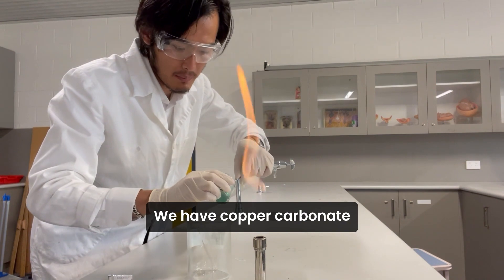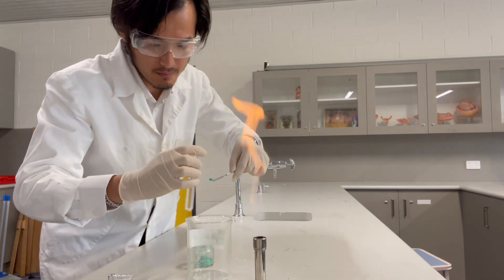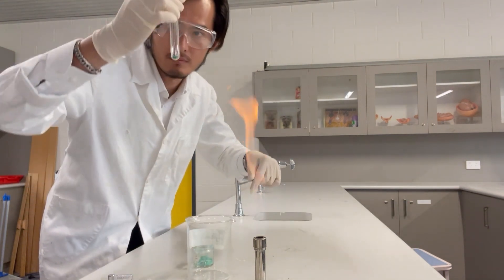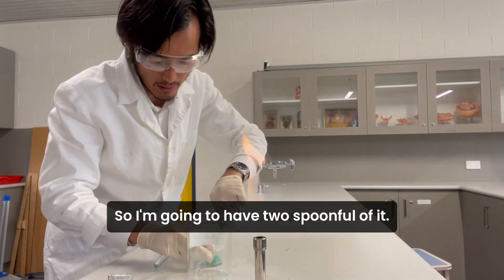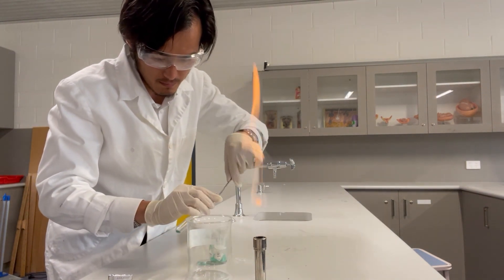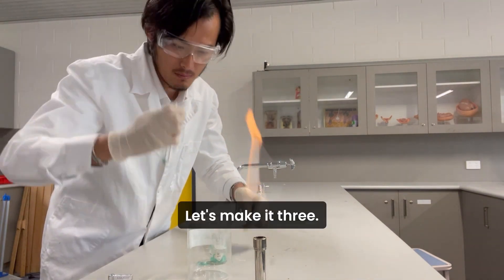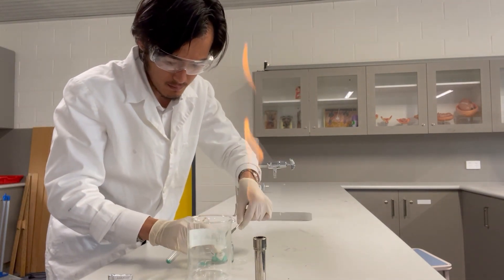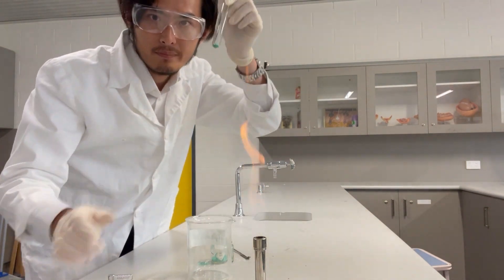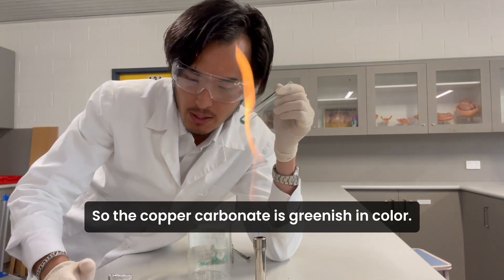We have copper carbonate, and I'm going to put some into a test tube — about two to three spoonfuls. The copper carbonate is greenish in color.